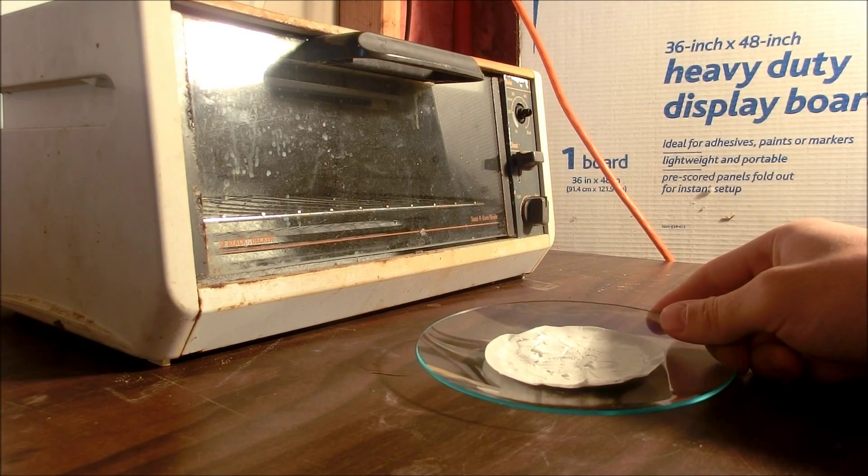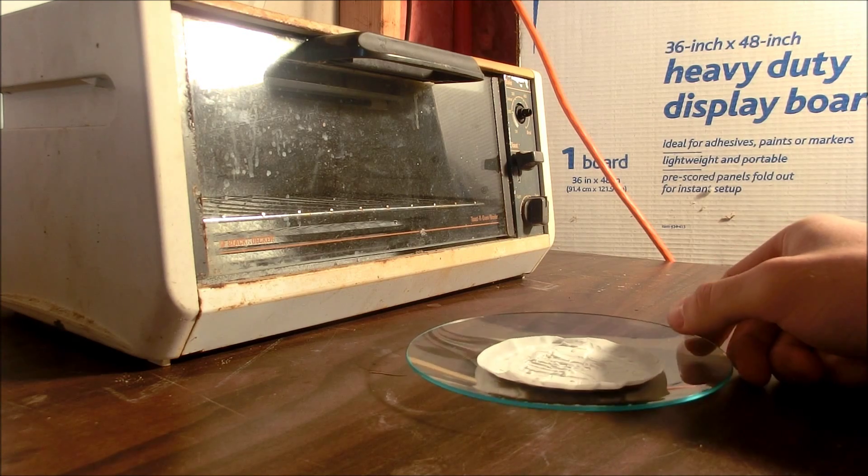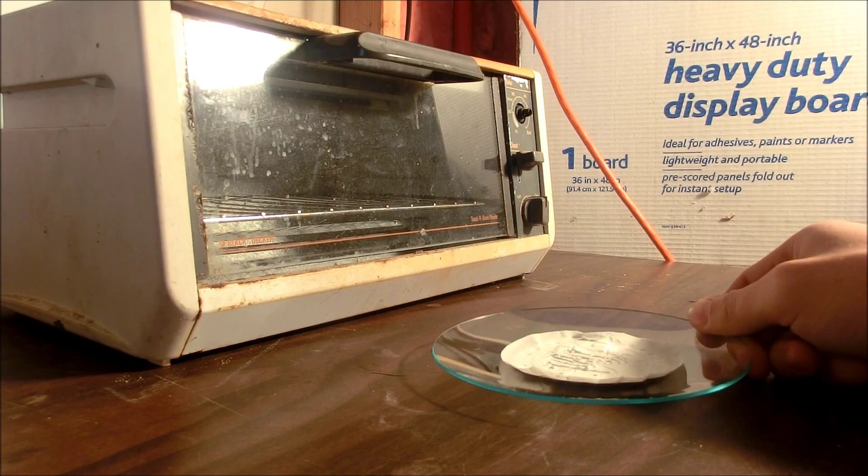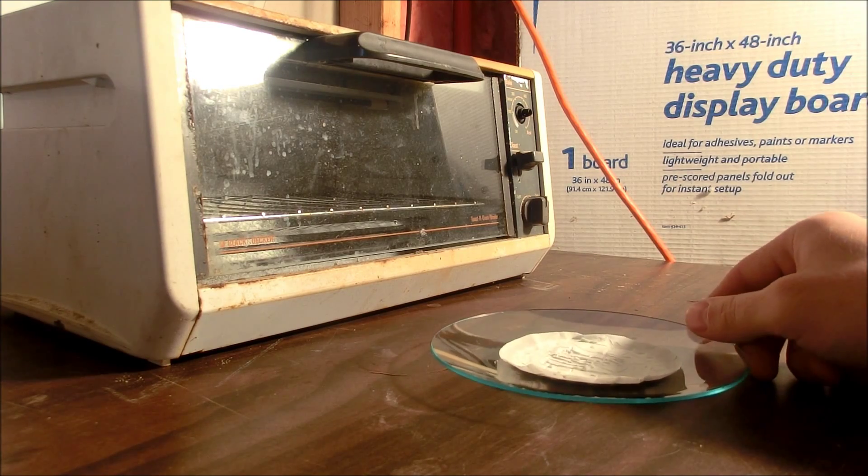After washing the zinc sulfide several times, I just let the vacuum pump pull air through it to partially dry it and then I transferred it to this watch glass and I'm going to put it in my lab oven and let it dry.